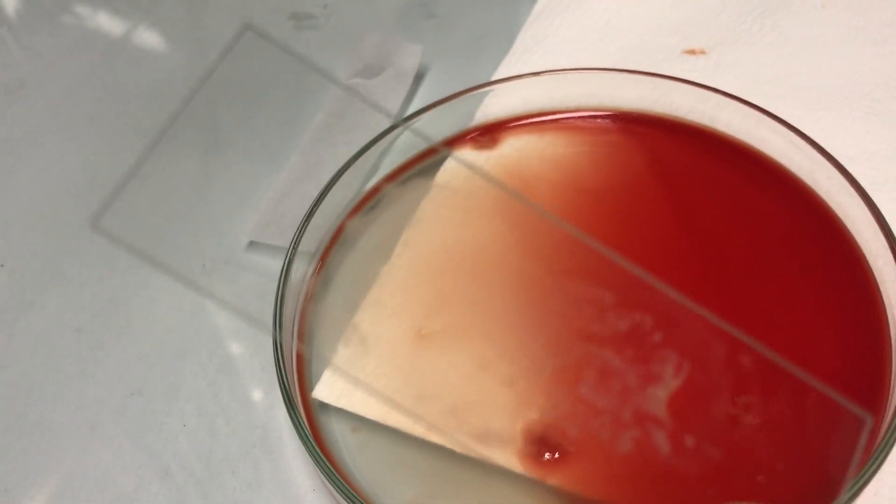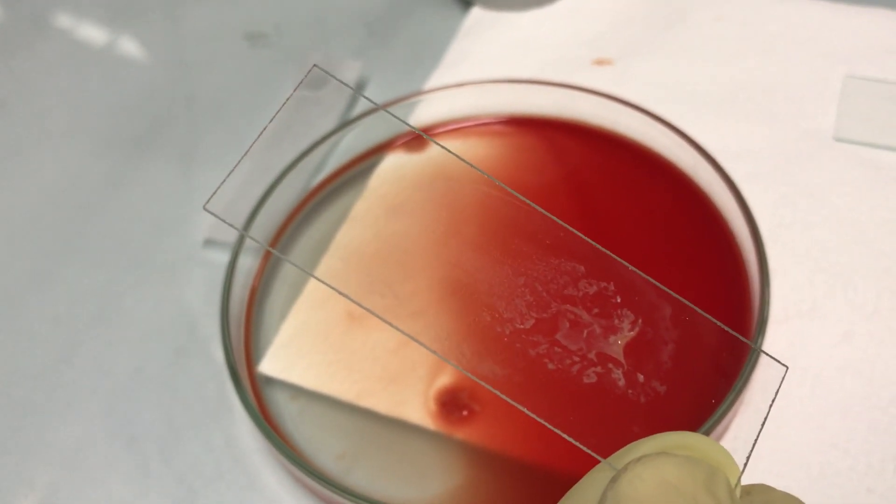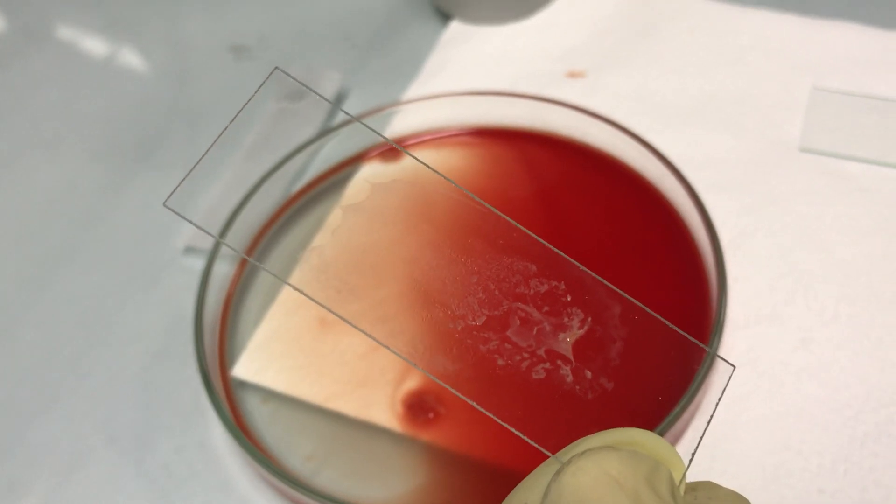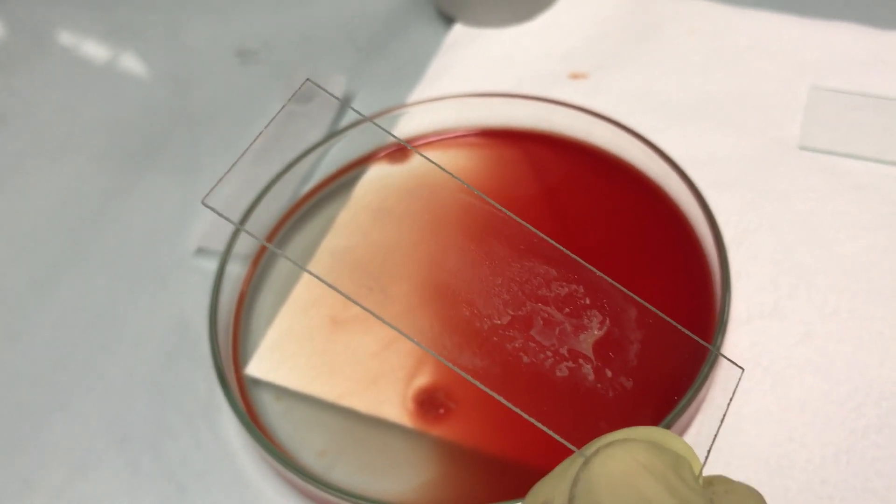Now the glass slide contains the marrow particle smear. This is ready for Leishman staining and microscopy for the identification of LD body in bone marrow.